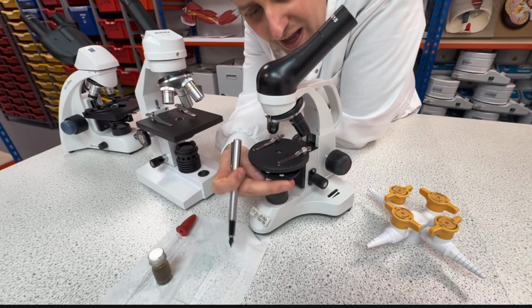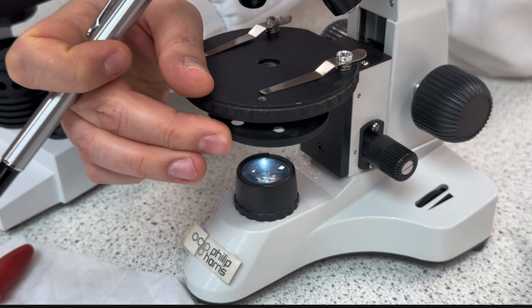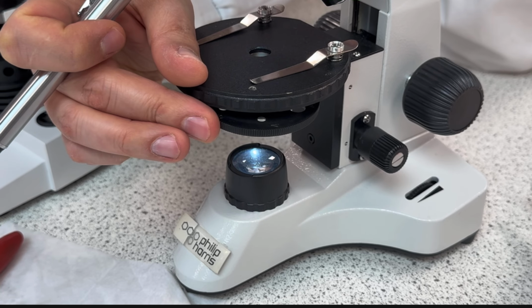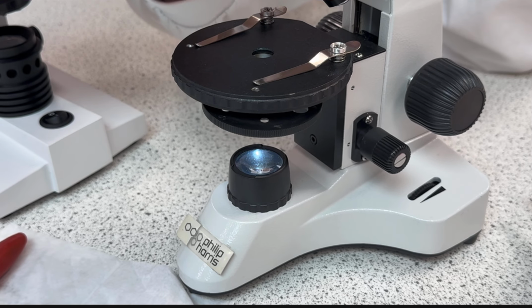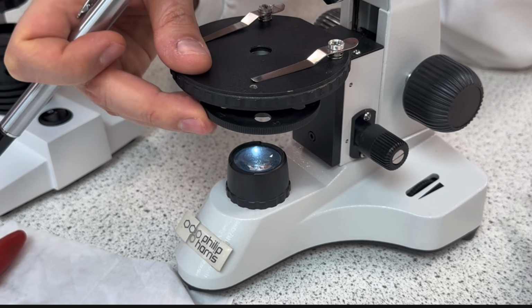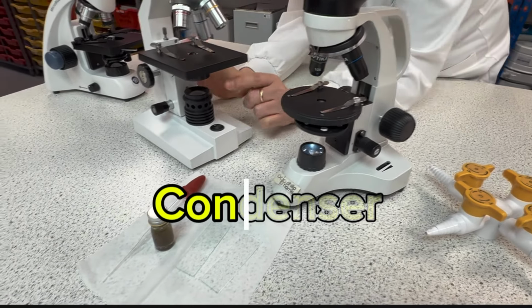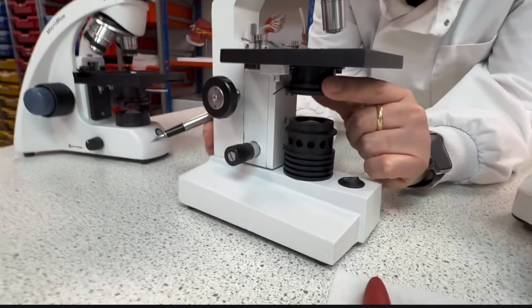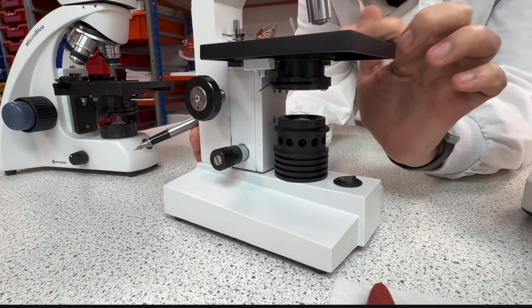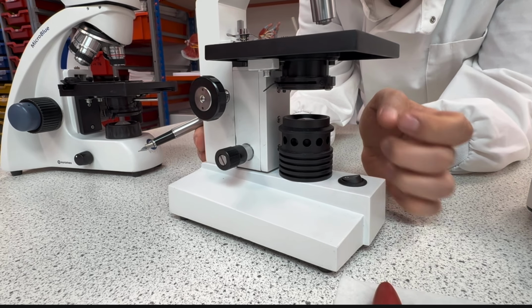And under here, I have a little dial where I can rotate and control or filter how much light is passing through and going through the objective. Okay? And also this part is part of a bigger one called the condenser. Here in this one I have the condenser as well. So as the light is condensed through a small hole, I'm able to see better.